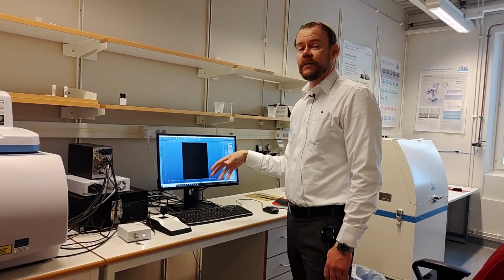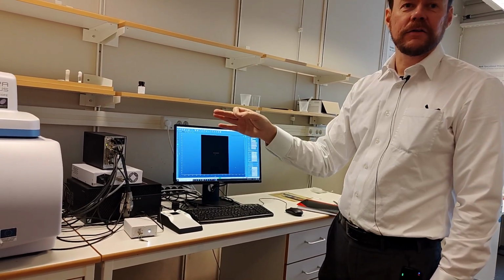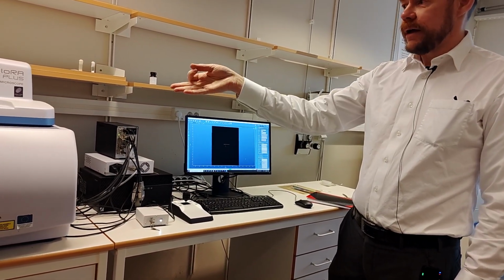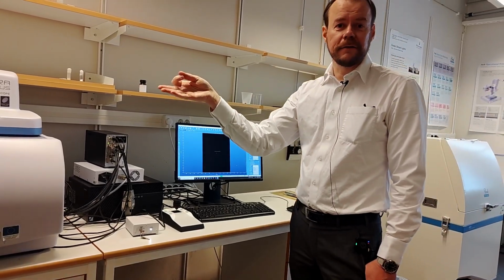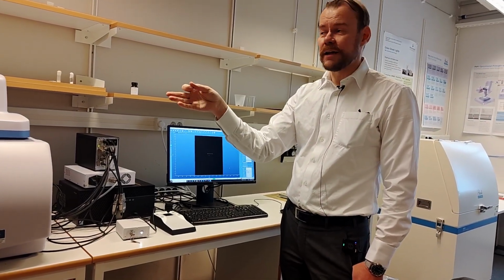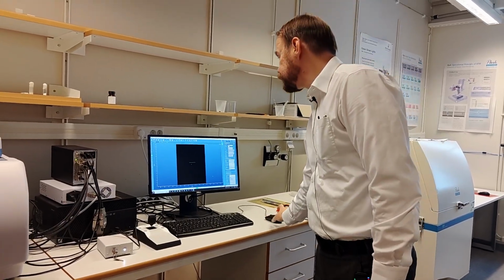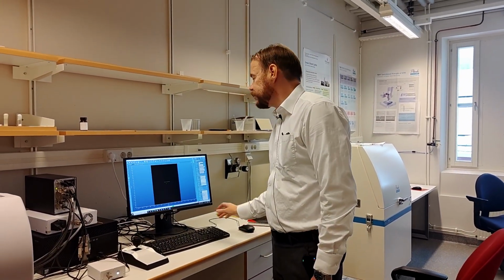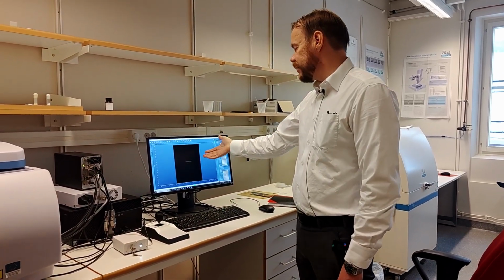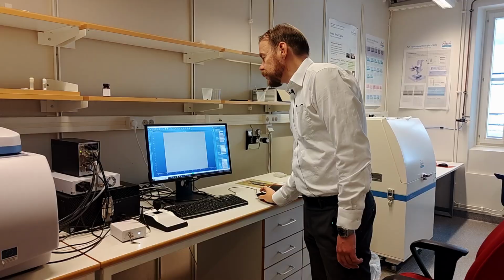The next step is to check, do we get the spectrometer online also? Do we see the Raman signal from the silicon? Silicon has a characteristic Raman signal at, I think, 520 reciprocal centimeters. So we can go back to the top here, because this internal camera is weaker than the top camera, so you want to use this top camera.